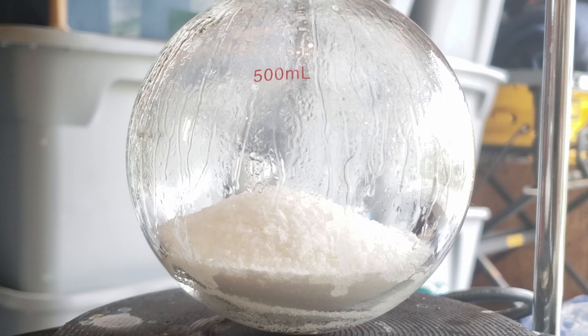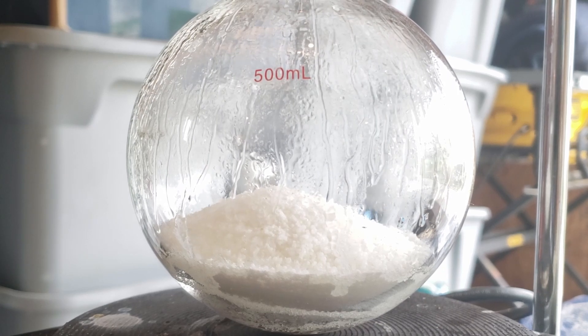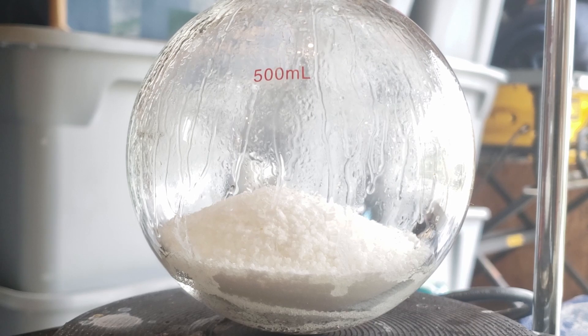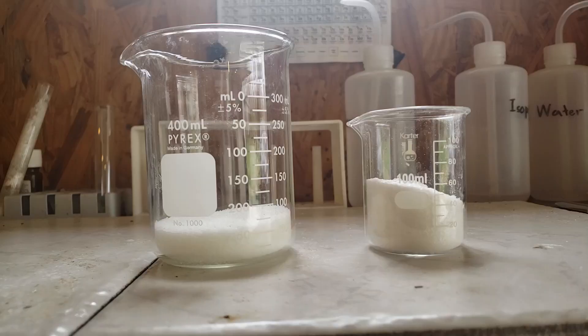Before we get started, it's important to make sure that your sodium acetate is anhydrous, as if it's the trihydrate, all of the water molecules in the trihydrate will end up in your product.